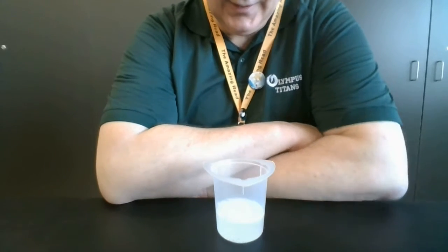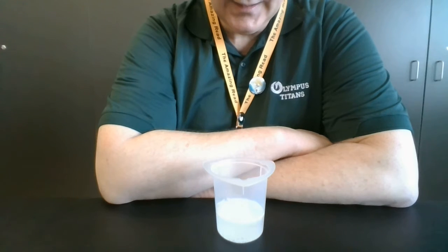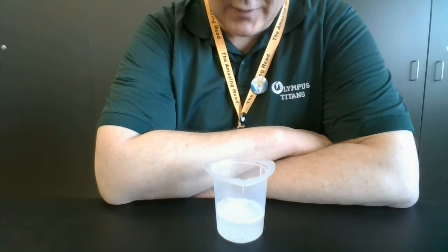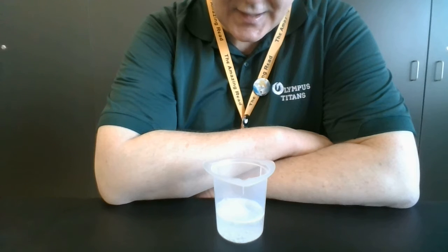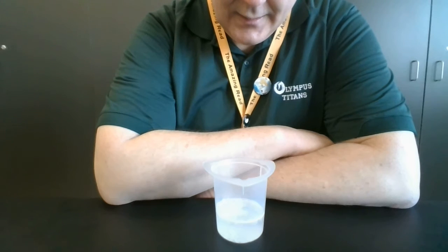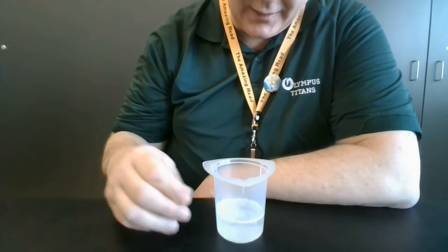Okay, and this is still going along bit by bit. Still got a pretty significant chunk in there. So as I'm watching, I'm kind of watching to see when the biggest chunk breaks up and when there are no more significant sized pieces. And looks to me like the last piece is gone, so stop timing for this one.